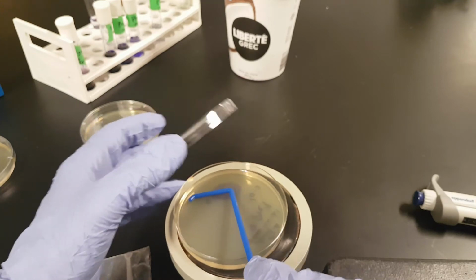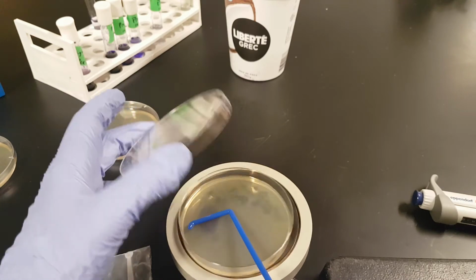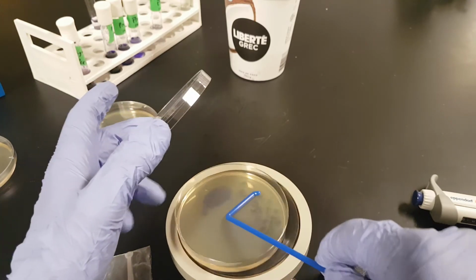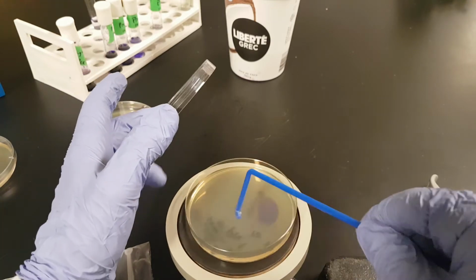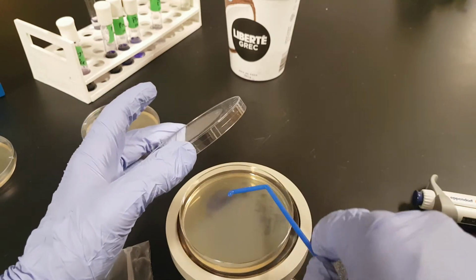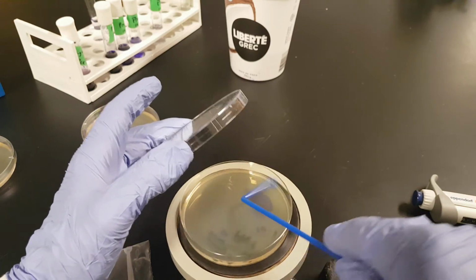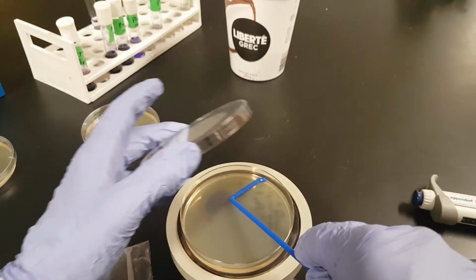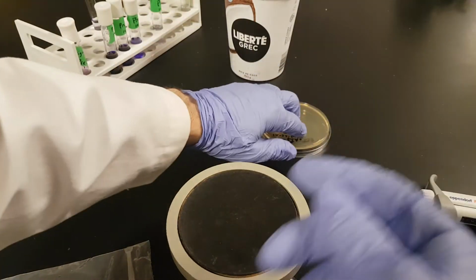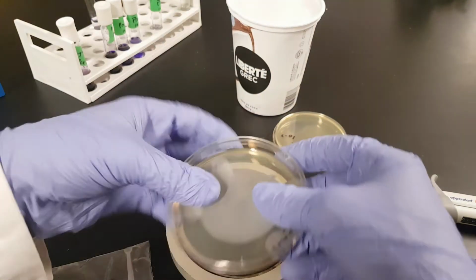It's just bad news. Okay, so what we want to do is you put your spreader down and you just sort of turn it, okay? Then you can turn it over and do it again, sort of move it around. You just want to spread things as evenly as possible across this surface, okay? So the last thing you want is to have just a big chunk somewhere that's not spread out, or you won't get a good count. Okay, so after you've done that, go ahead, set it aside, you toss your spreader in the Dettol, you're good. Go to the next one.